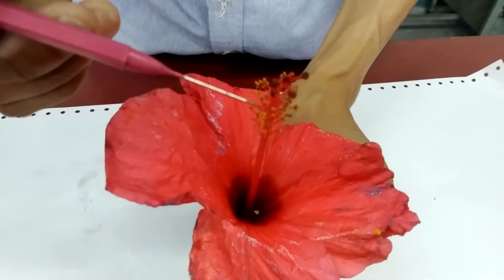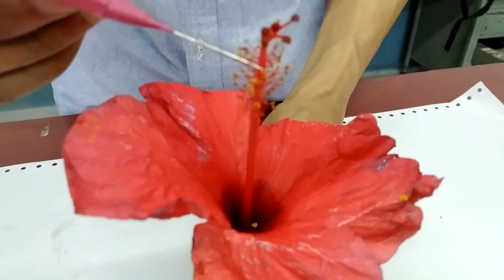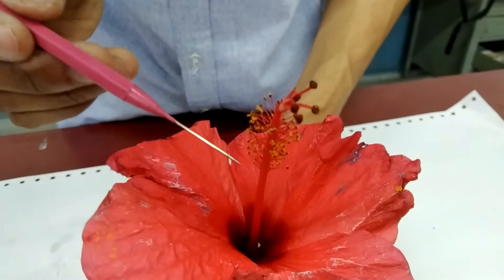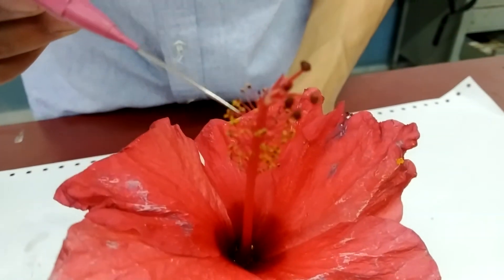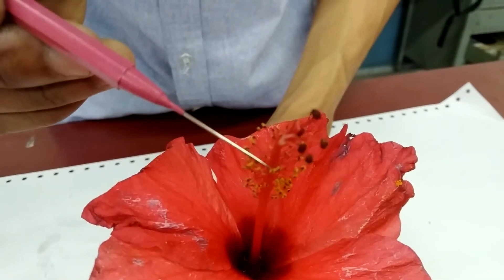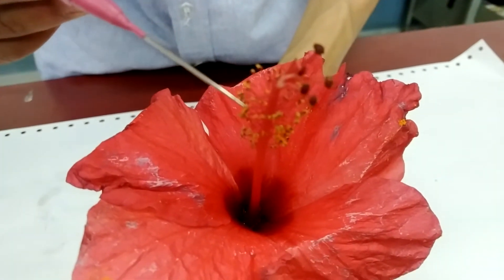This yellow portion represents your anthers. The anthers are numerous and are connected to a filament. From here to here represents your androecium.